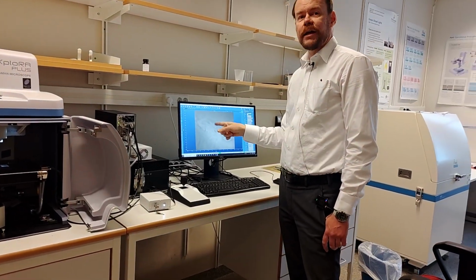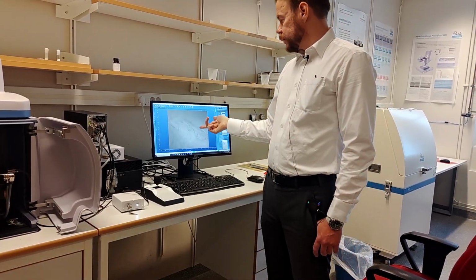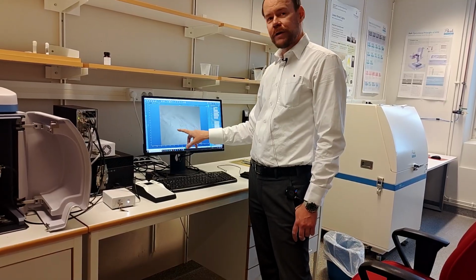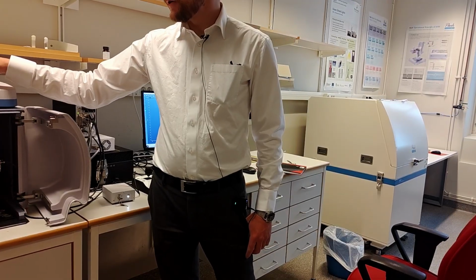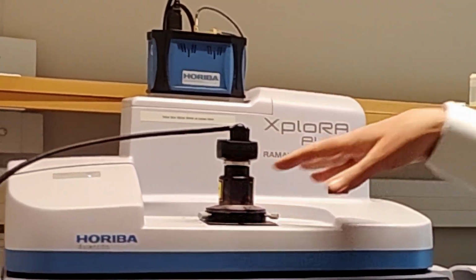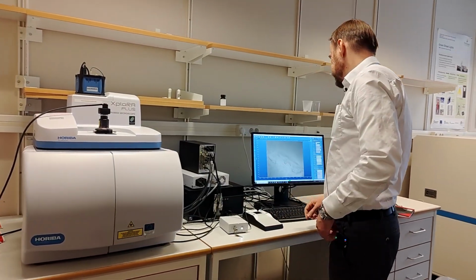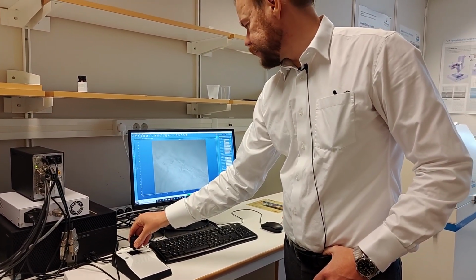So if you want to actually check that, you put in a small piece of tissue paper, close everything up, turn on the laser at 100% for some time, turn it off, and check in the camera, because then the laser will have burned a hole in your tissue. If the hole is up here, then you need to realign it with the screws here. But if people don't fiddle with this, then it should be calibrated like that. So let's close this up now, because we want to run a spectrum on that thing. Now you see it became a little bit offset due to that, so I can refocus like that.